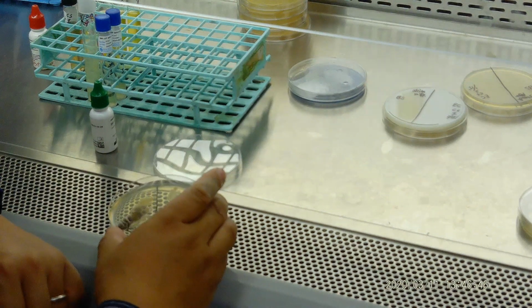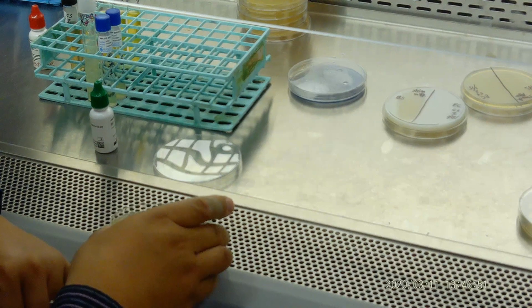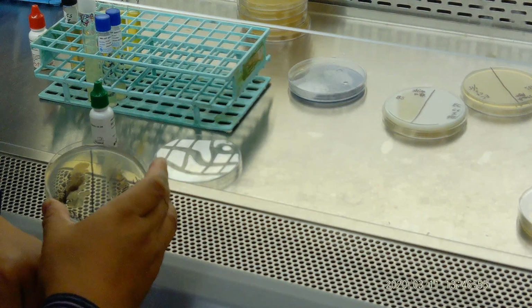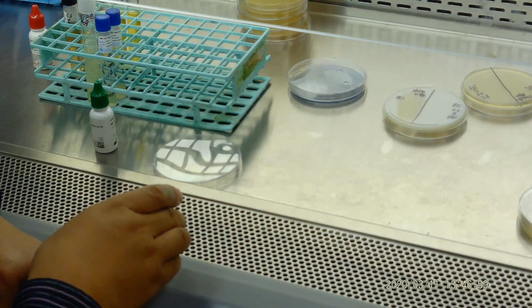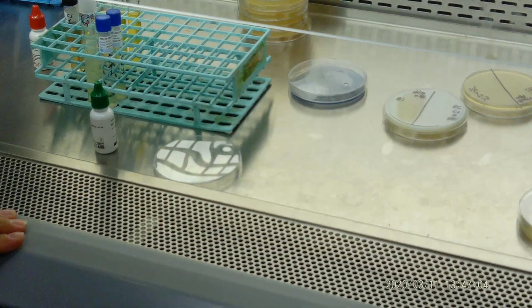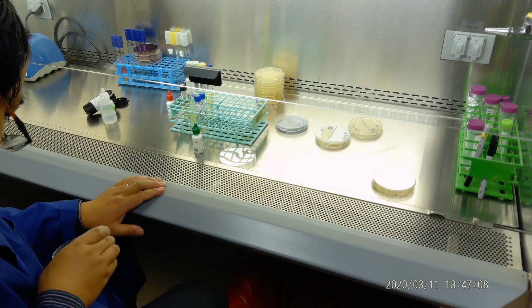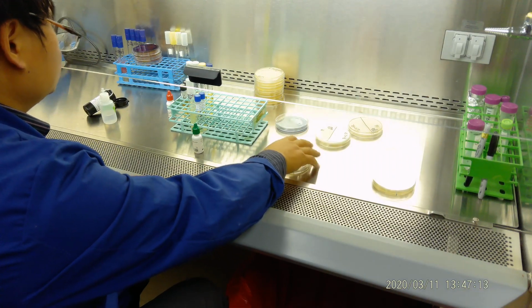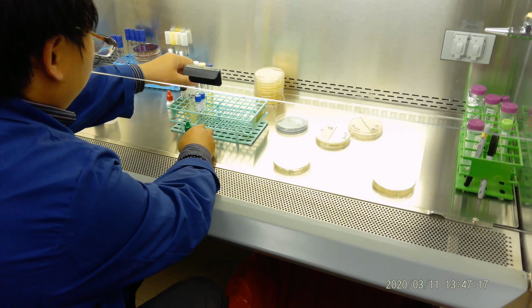Otherwise it's negative. We need to let it react a little bit. Okay, so here we stop.